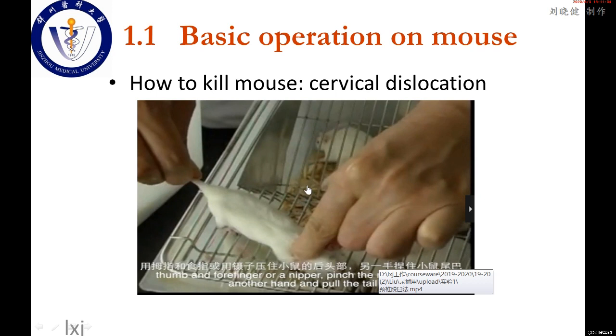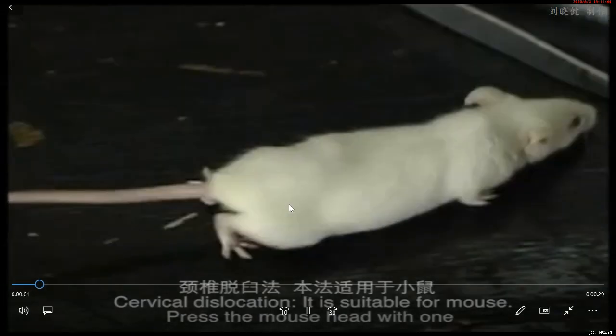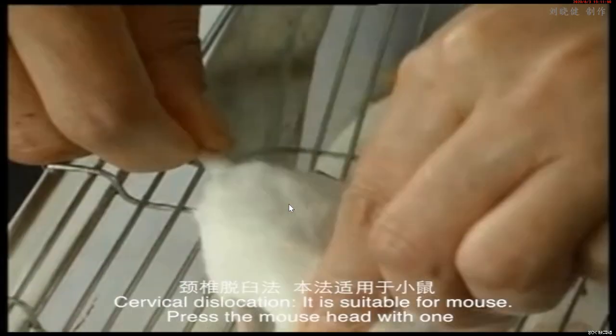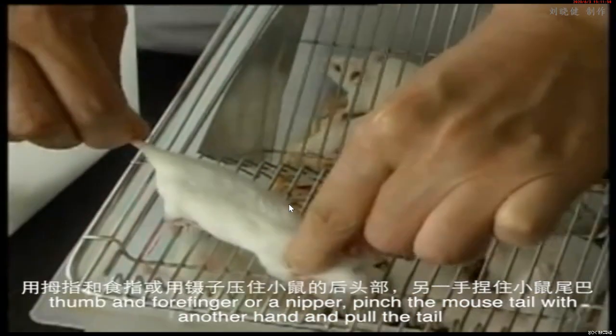The method for the mouse is cervical dislocation. Now, watch this video. Cervical dislocation is suitable for mice. Press the mouse head with one thumb and forefinger or a nipper.